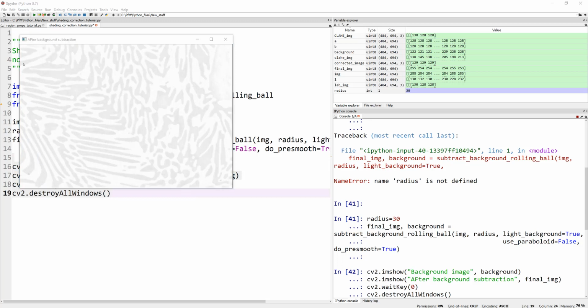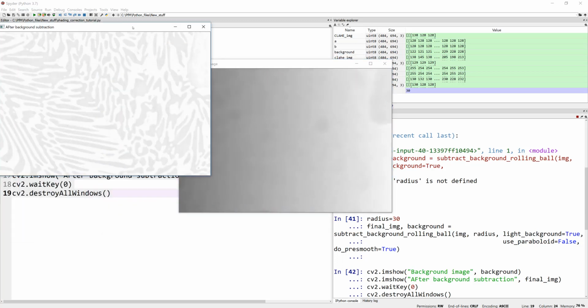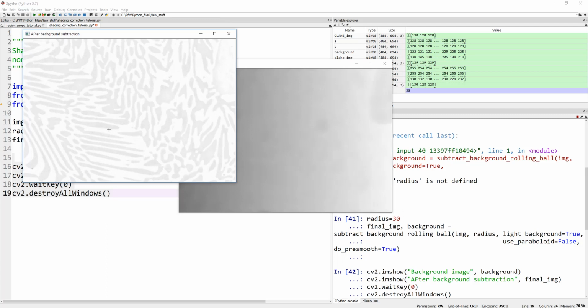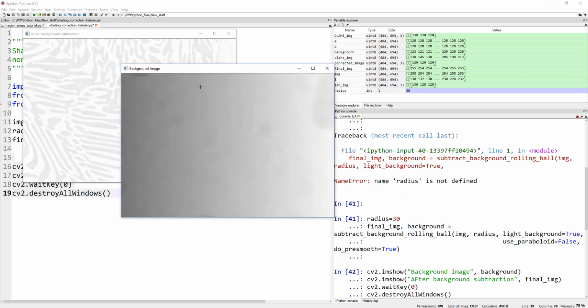So this is my background, and this is after background subtraction. I'm not sure if you can see anything. There are some features in there. And here is my background. You see how the background here is dark, and as you go progressively, it gets brighter. That means it's actually doing a good job. That's my background image.